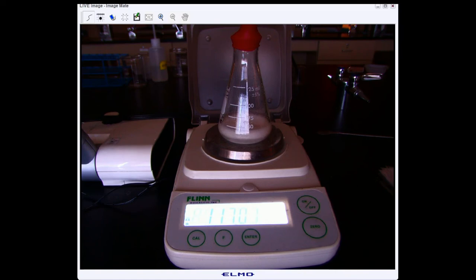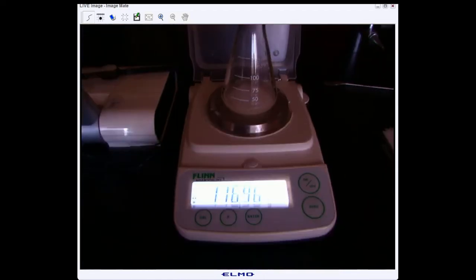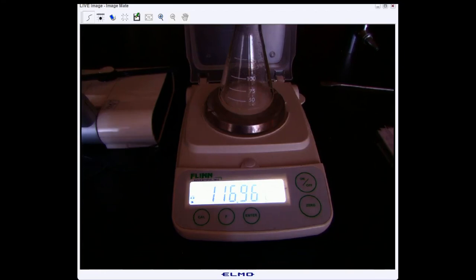Give the reaction a second to run, and then we'll write down the mass once it looks like it's finished. All right, so in this case our mass is going to be 116.96 grams.